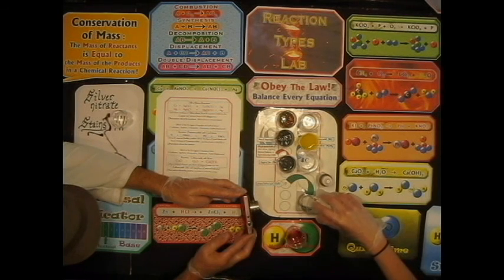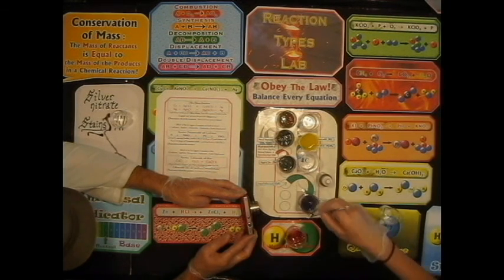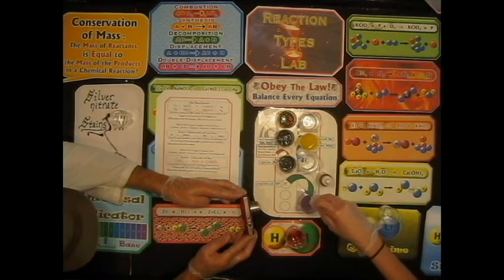So you might wonder, why are we using an indicator? That's probably enough. And then you might have to stir it up. Do you guys notice anything? Oh, it was a dark purple and now it's getting lighter and lighter. It's a violet. But it wasn't purple at all to begin with, right? It was green, wasn't it?